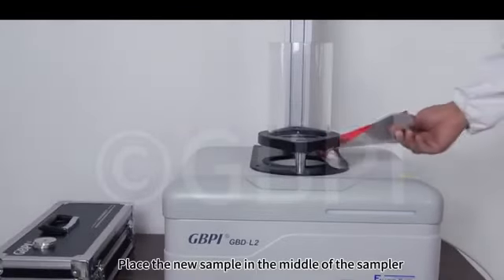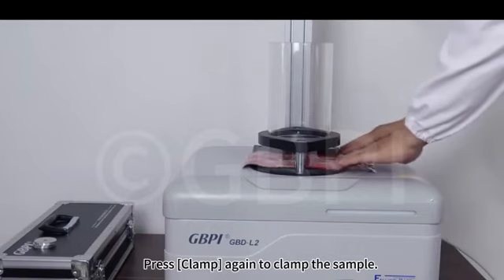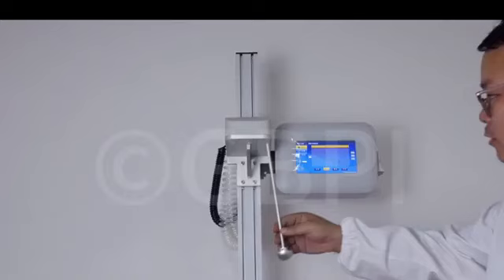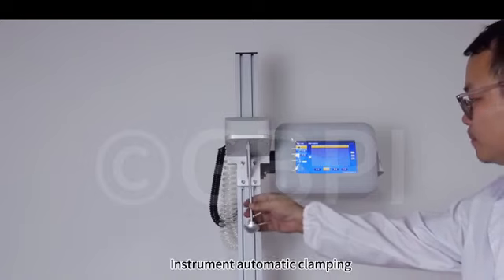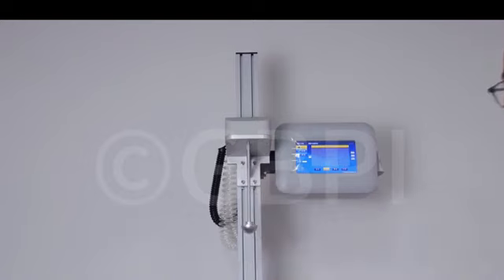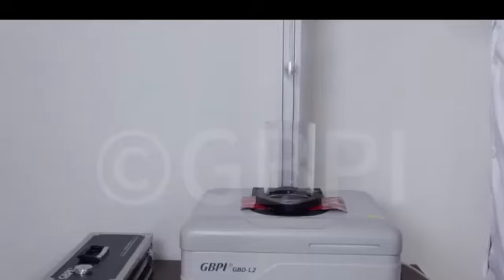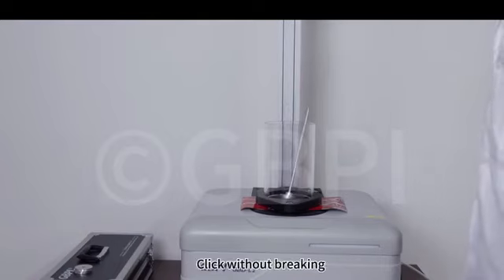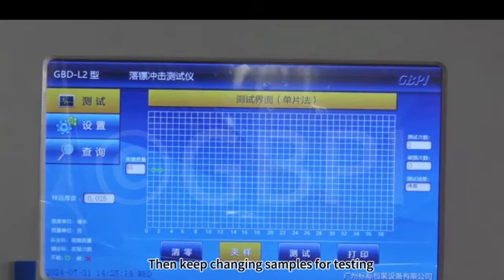Place the new sample in the middle of the sampler. Press Clamp again to clamp the sample. Reinsert the dart into the hole. Instrument automatic clamping. Click Test. The sample is not broken. Click Not broken. Replace a sample and clamp according to the above steps. Then keep changing samples for testing.